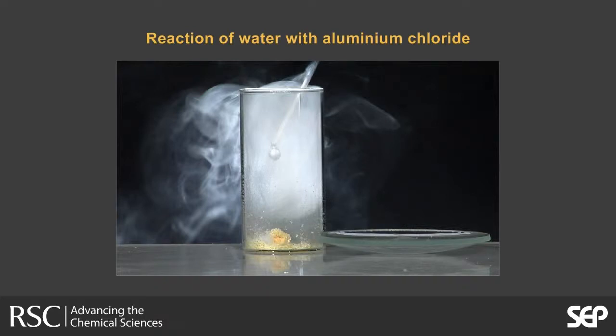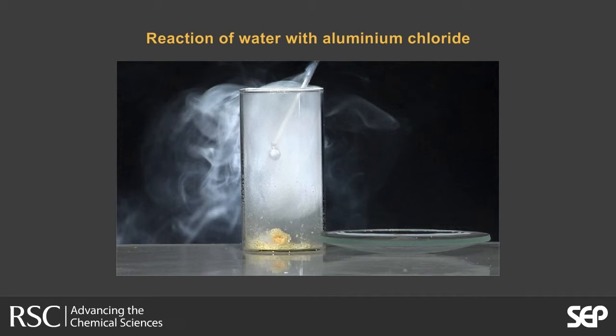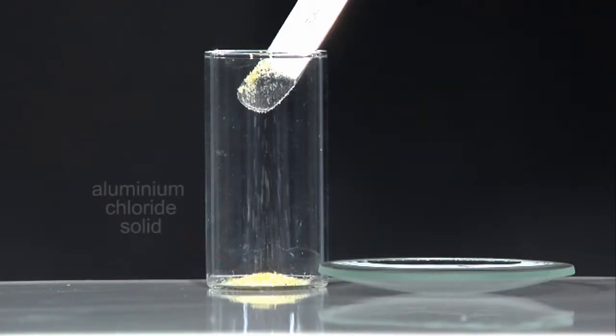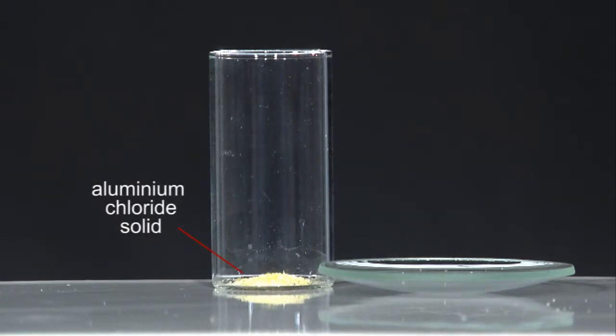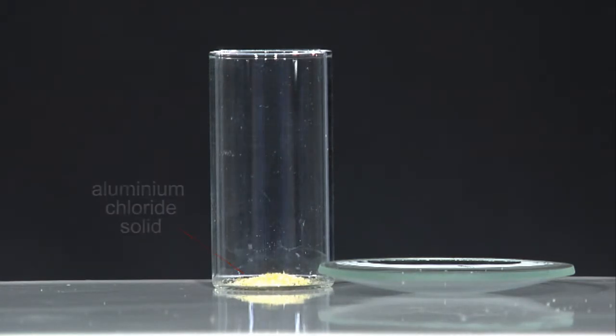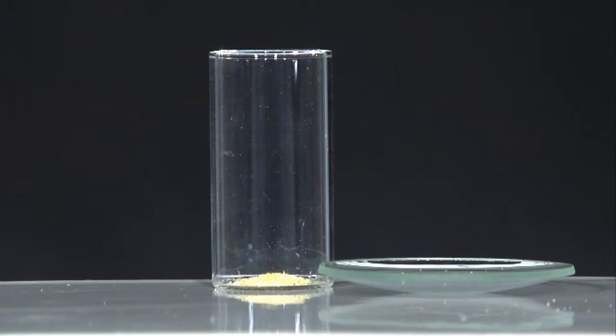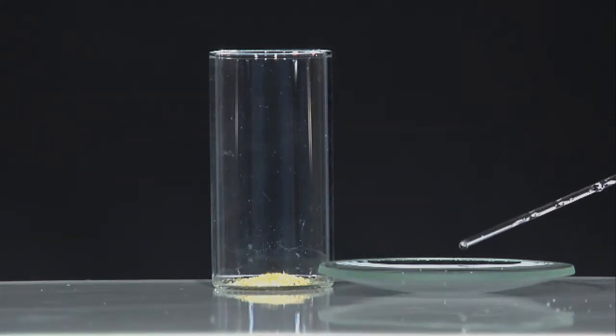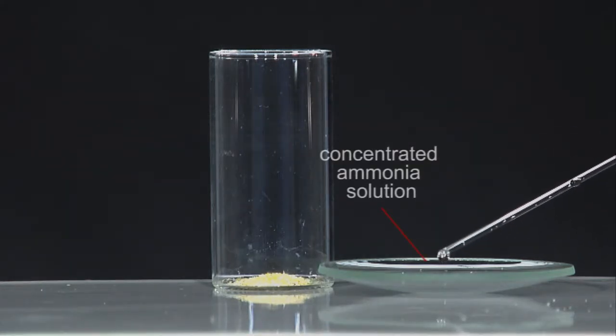Covalent halides typically undergo hydrolysis; in many cases the reaction can be vigorous and exothermic. The aluminium chloride is placed in the bottom of a sample tube. In the watch glass to the right of the sample tube, a few drops of ammonia solution are added.